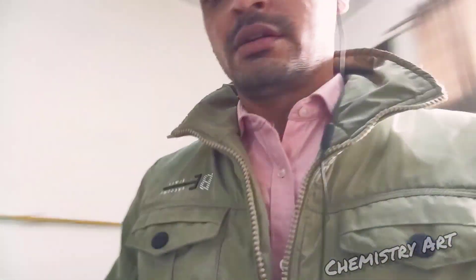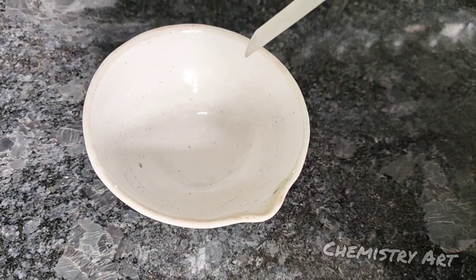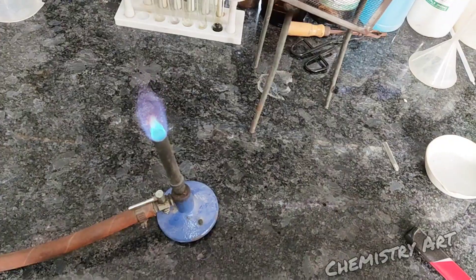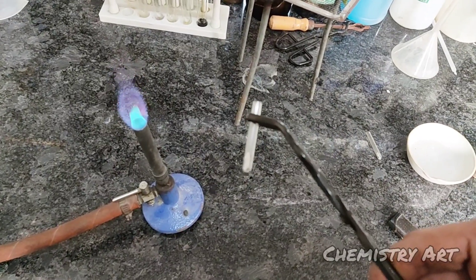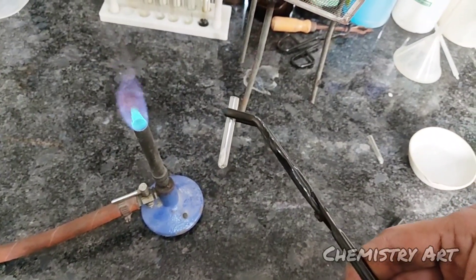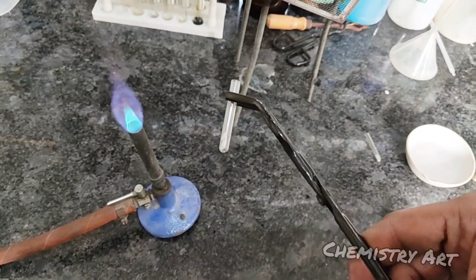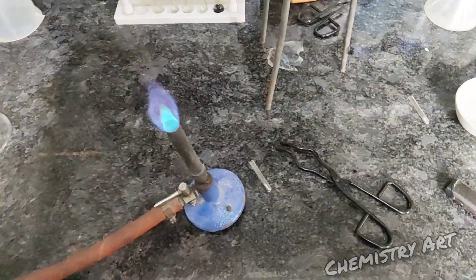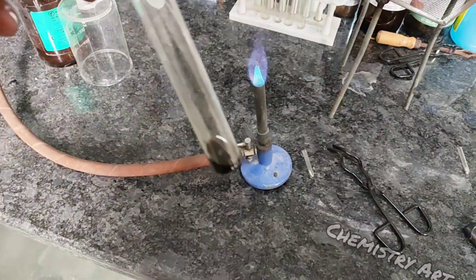This fusion tube has to be heated in a burner. During this time, take around 15 ml of distilled water in the china bowl. I have started the burner and the fusion tube contains sodium. We heat the fusion tube until it becomes red hot, and at that time we will add our organic compound — this is the compound I need to identify the extra element in.